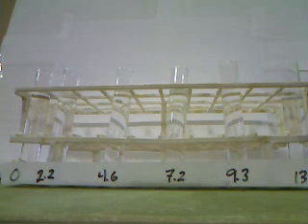We're now going to try the alizarin yellow R in each of our 6 solutions.